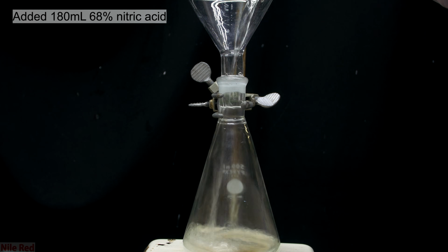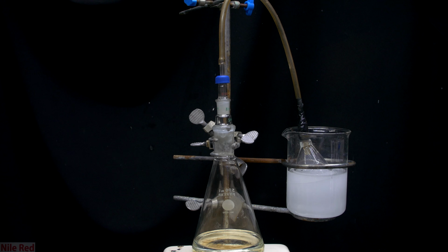I started off by adding the nitric acid to a flask. Once it was added, I set up the rest of the apparatus, and you can see what it looks like here. The first step is to react nitric acid with mercury, and this produces a lot of nitrogen dioxide gas, and this apparatus is set up to prevent it from leaking and going everywhere in the lab environment. As the nitrogen dioxide is produced, it should be forced out into the inverted funnel trap you see on the right. The white liquid you see in the trap is just a sodium hydroxide solution, and this should really easily neutralize any nitrogen dioxide gas.